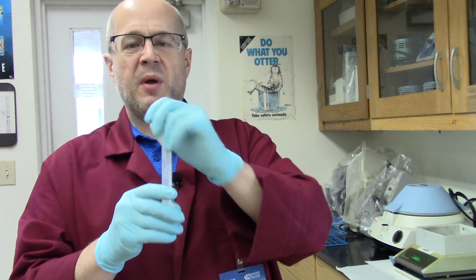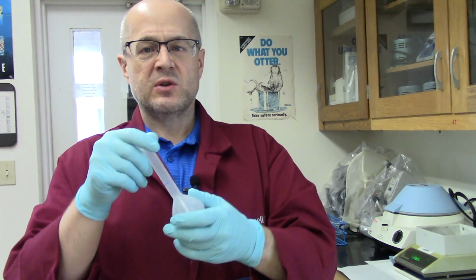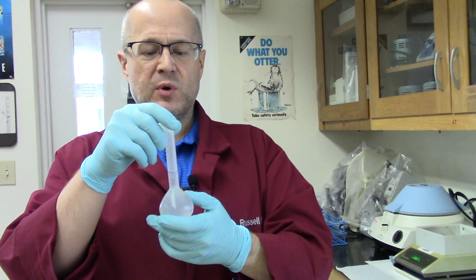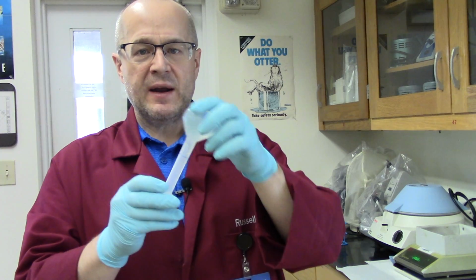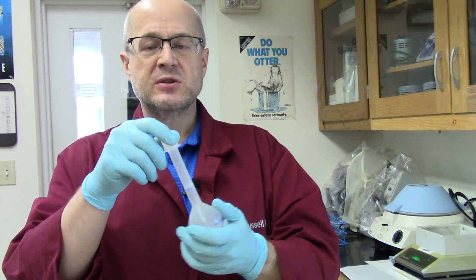Now what we're going to do is compare this solution to a standard solution of known concentration. So there's another solution that's been made. That is my standard. That's my premium. That's the one that I know is made perfectly correct. And we're going to compare it to the one we just made together. And hopefully we did a good job and we get the same concentration in both.